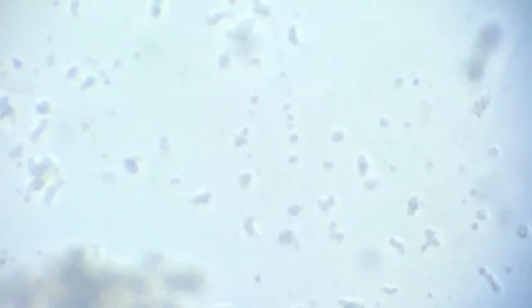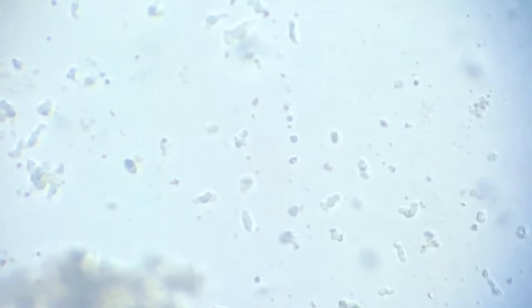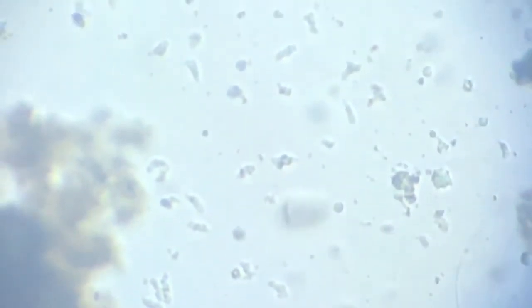Can you make them out? Yes, those little black spots, dark spots, irregular shapes scattered throughout, these are none other than amoeba, and they all seem to be moving with a purpose. They are mostly moving towards this little detritus so that they can have some organic food for themselves.